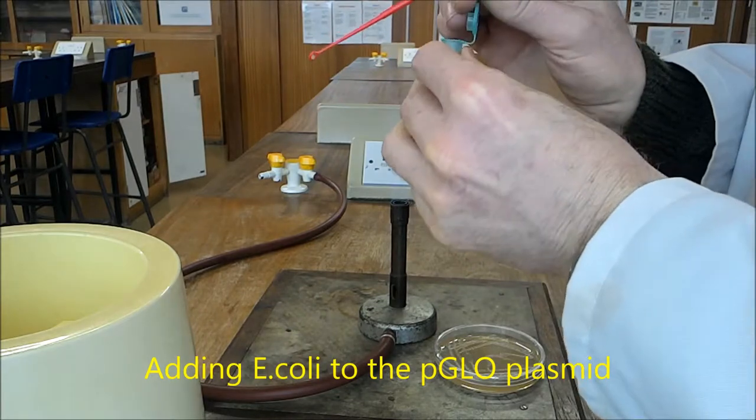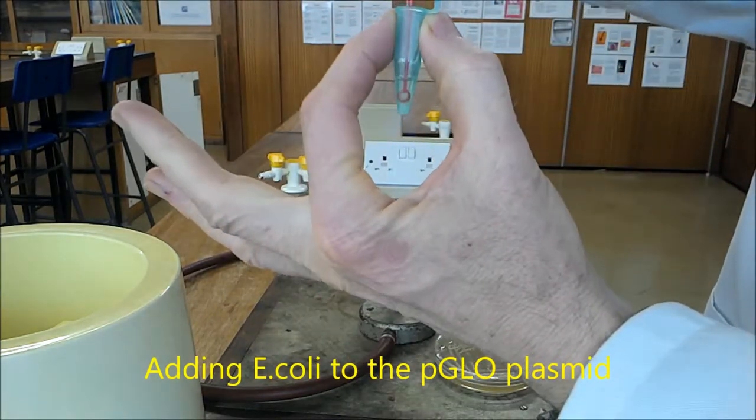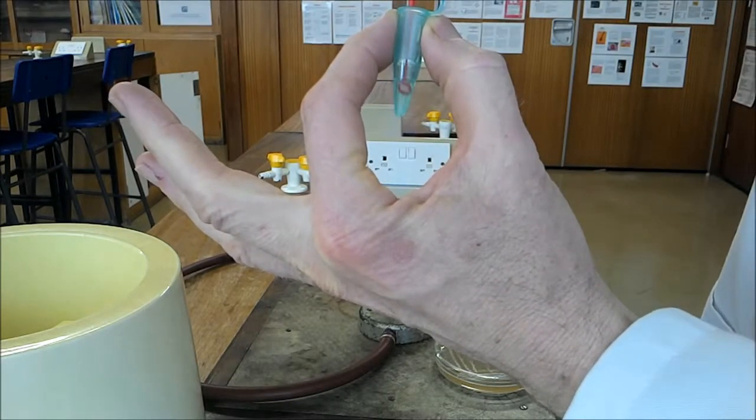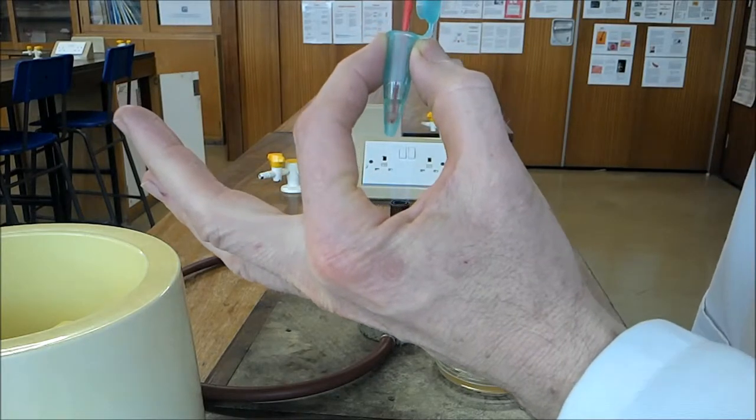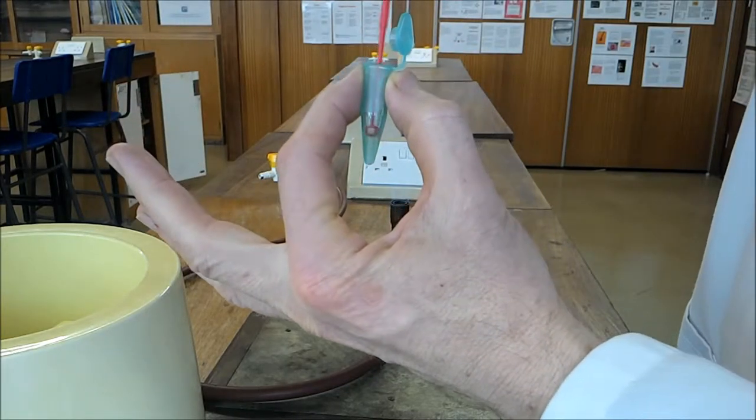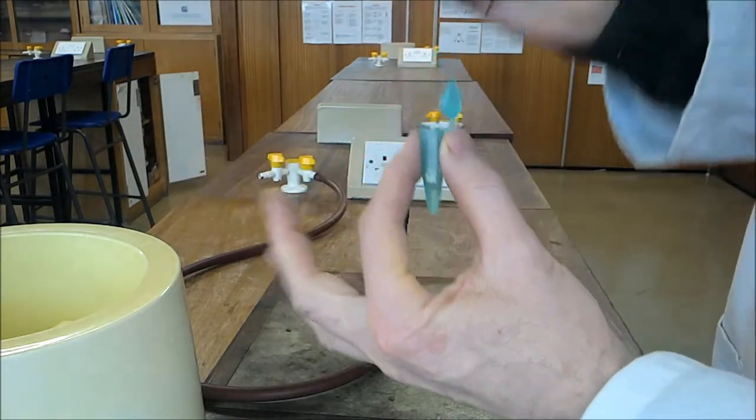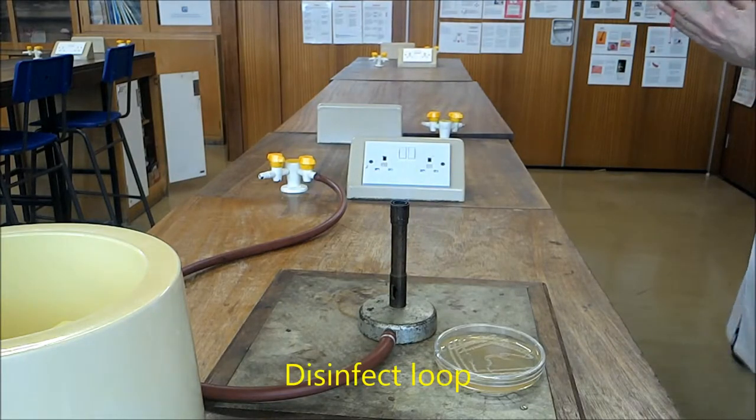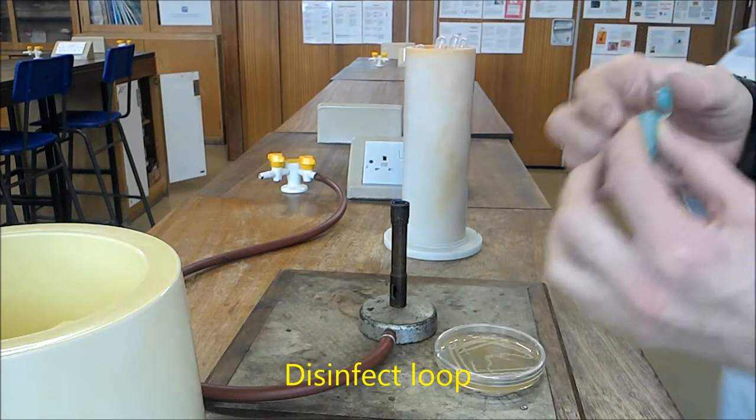Then I'm going to add that to the plasmid solution, spin it in there. Okay, get the bacteria into the plasmid solution. This needs to be sterilized. Put that into disinfectant, there it goes.